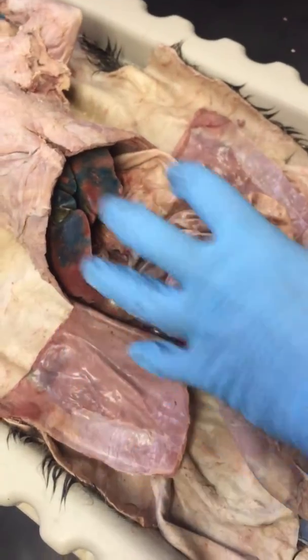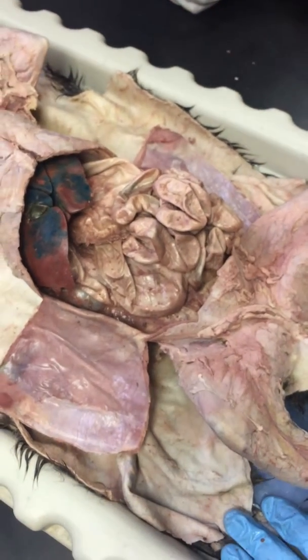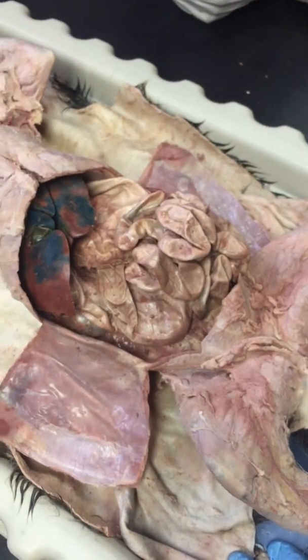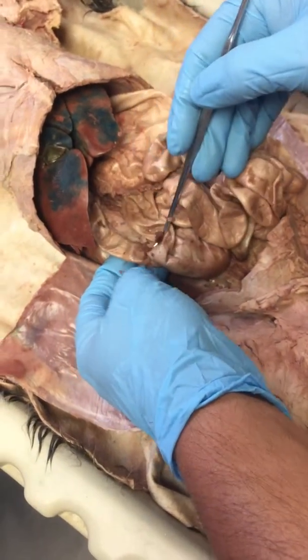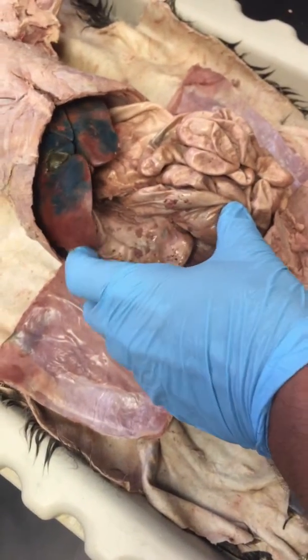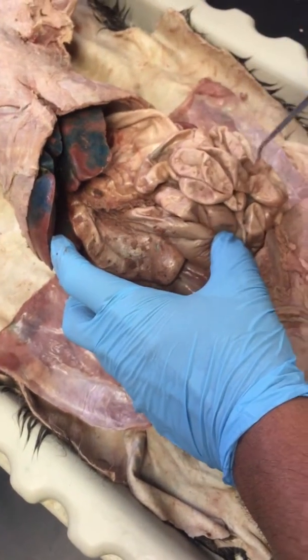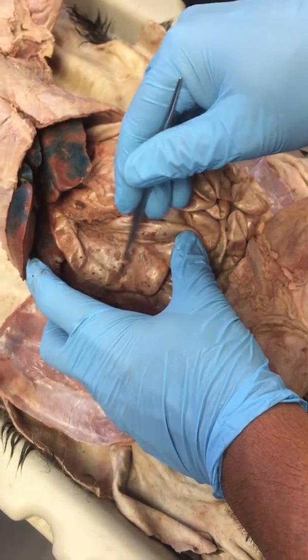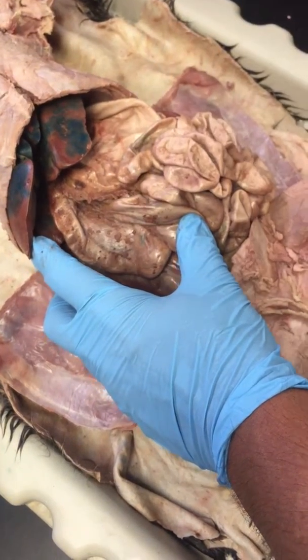Okay, now we also have our small intestine right here. Okay, there's three sections of small intestine. There's a beginning, a middle, and an end. The beginning of the small intestine is called the duodenum. Okay, now what you do to find the duodenum is you just go to the end of the stomach right here, and then here's the duodenum. The duodenum is the first probably 3 inches or so. Okay, now one of the things you'll notice right away as you look at the duodenum, it's not as curly as the rest of it is. Okay, the rest of it is really twisted and curly and all that kind of stuff. The duodenum just has kind of a real mellow curve to it. Okay, and that's the first probably 3 to 4 inches.